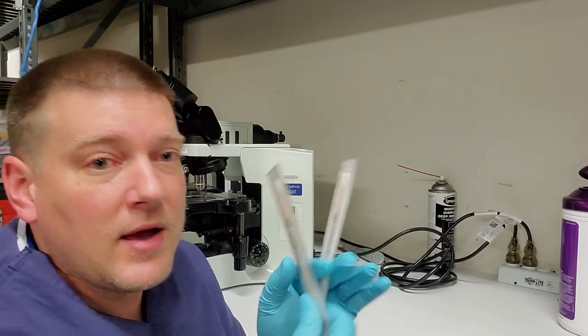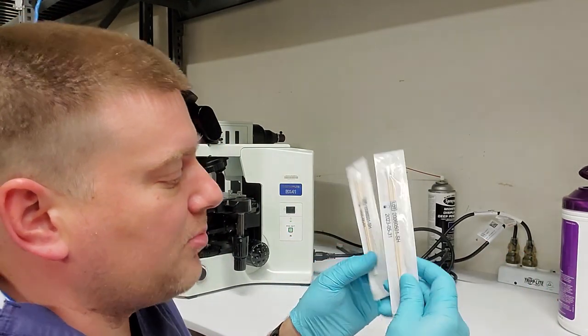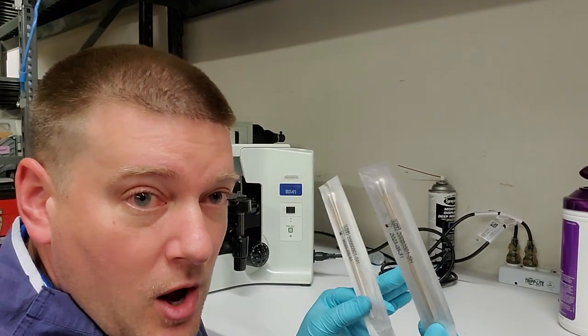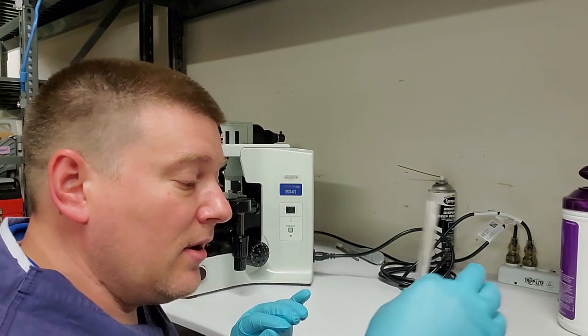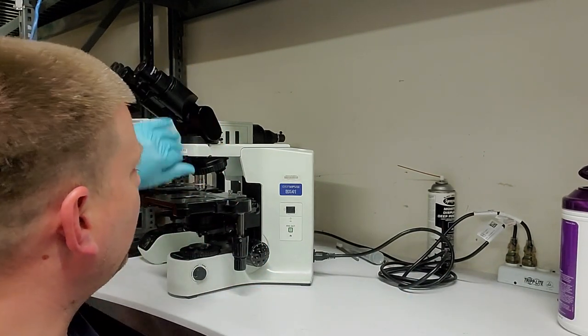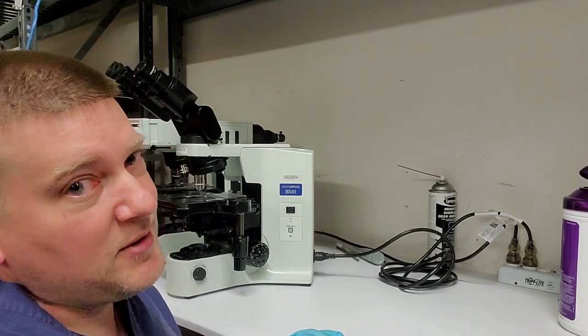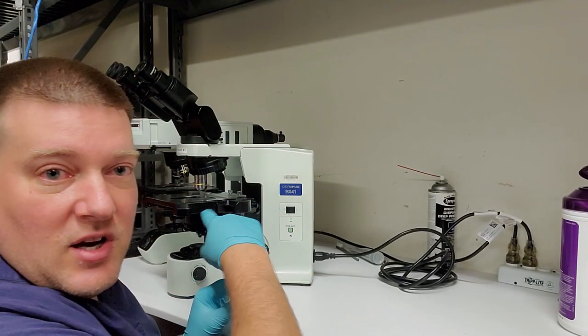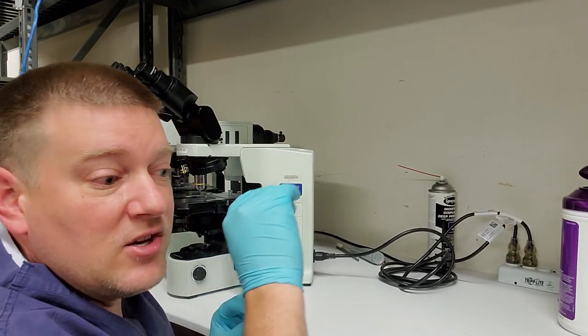Some of you guys might be like, oh no, don't use those. See these guys right here? These ones are Cardinal Health brand, but the long wooden Q-tips, clean, unopened, absolutely necessary because when you start pulling this stuff apart, if your microscope hasn't been shown love in a while, it's going to need some love. And I mean, maybe some lubrication on the ways, to which you're going to put some lubrication on it and then you're going to get rid of it.